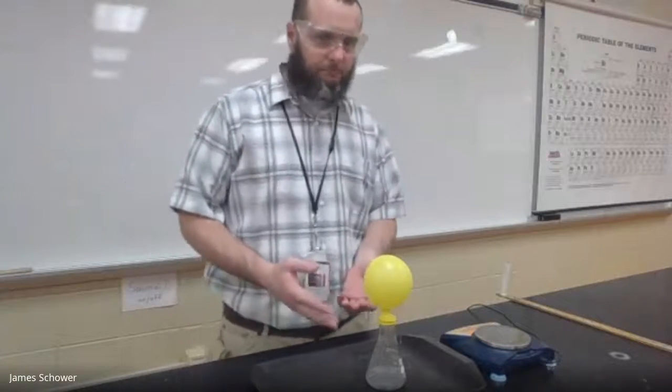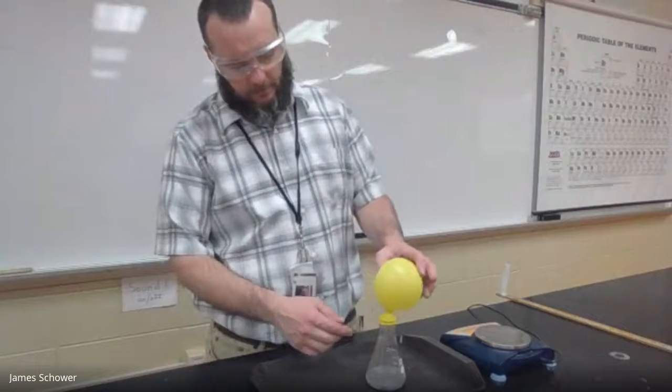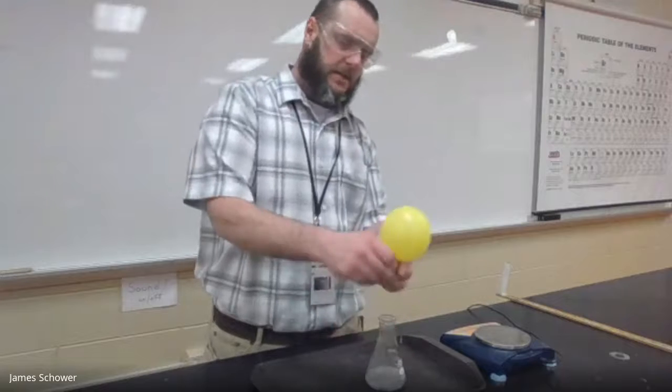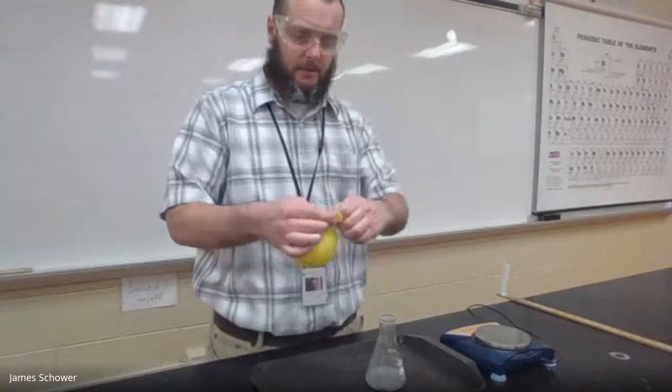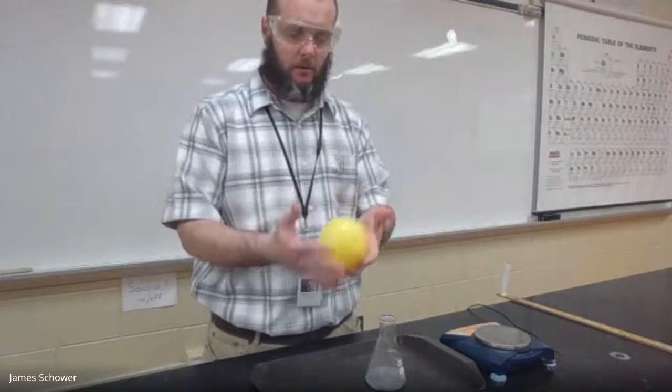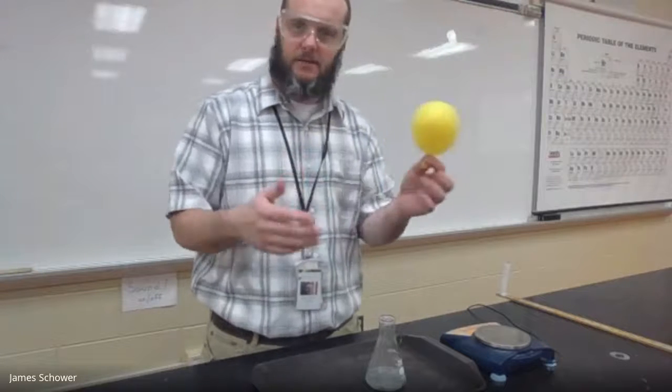All right guys, as you can see I let the balloon fill to the top and I'm going to take it off and tie the knot like so. All right, now this is filled with hydrogen gas so we're going to check to see if it's flammable.